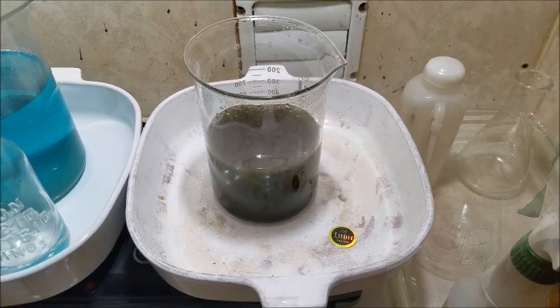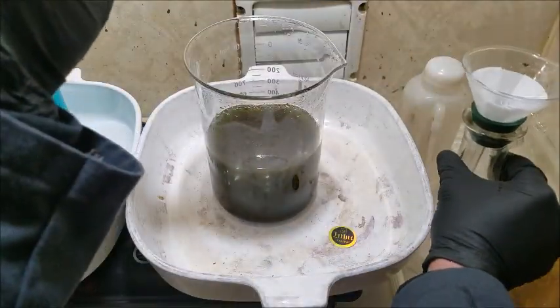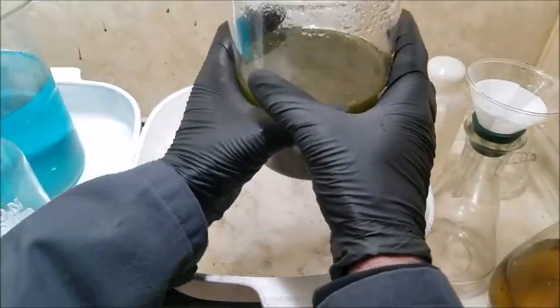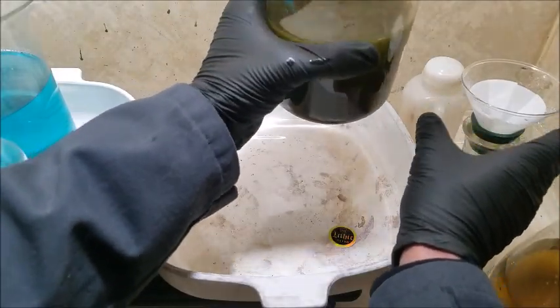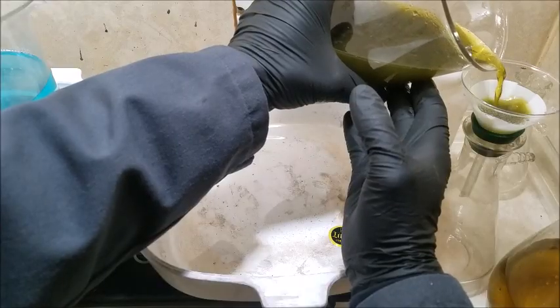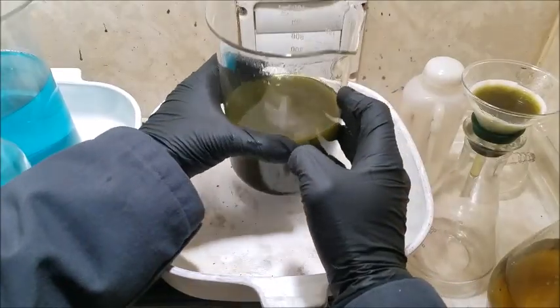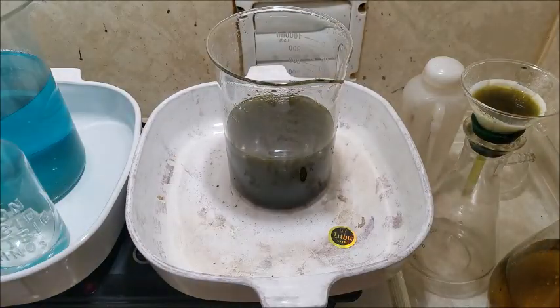Alright, we can get right to business. I just put a fresh filter in this funnel here. And I'm just going to start pouring this off. I'm interested to see what we have here. I can't imagine all the particles that I'm seeing are gold. There just wasn't that much in there. So let's just see what we come out with. I don't think I'm going to be all that pleased, but still a fun experiment. I'm going to let this go for a while.